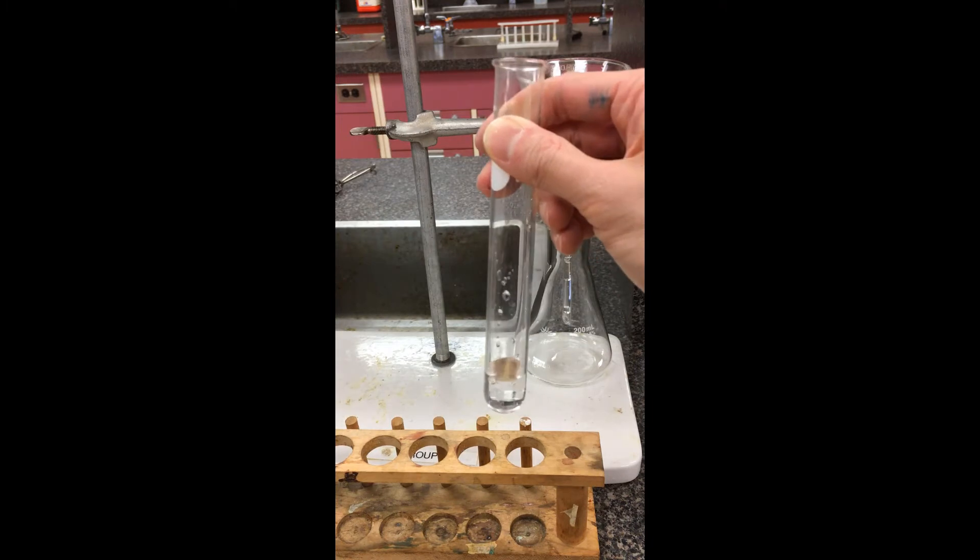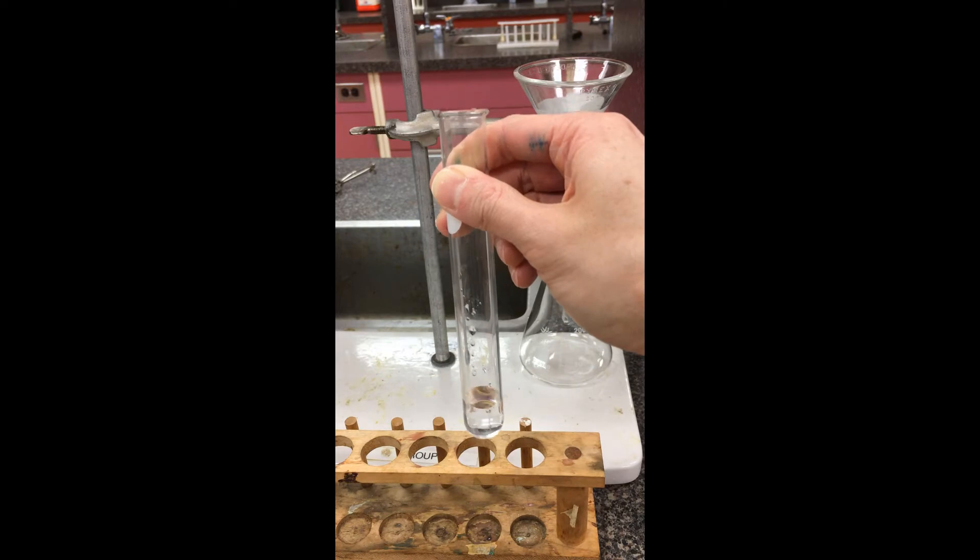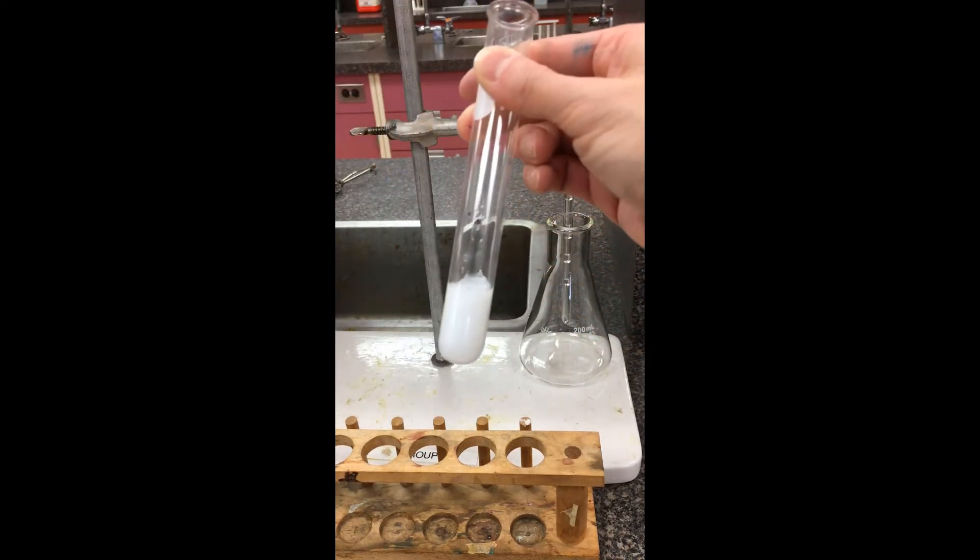In a similar way here, we're going to just open up the sodium carbonate. We're going to form that precipitate reaction here. Should happen pretty quick. Okay, so there we go.